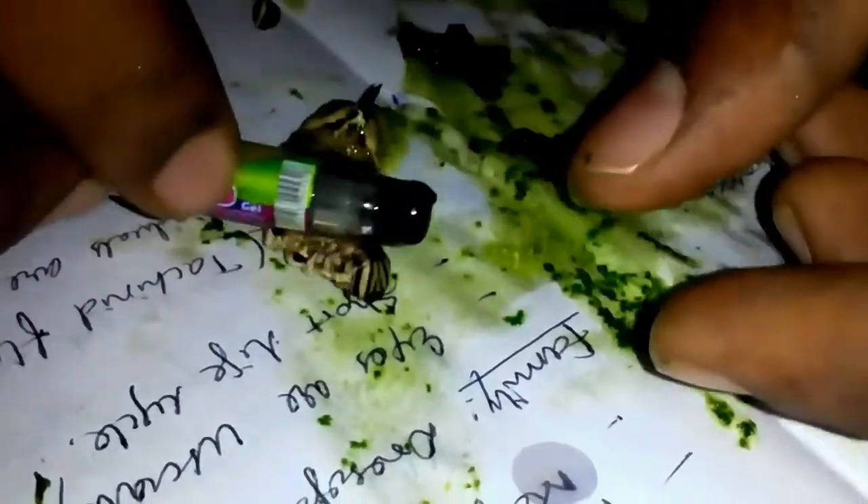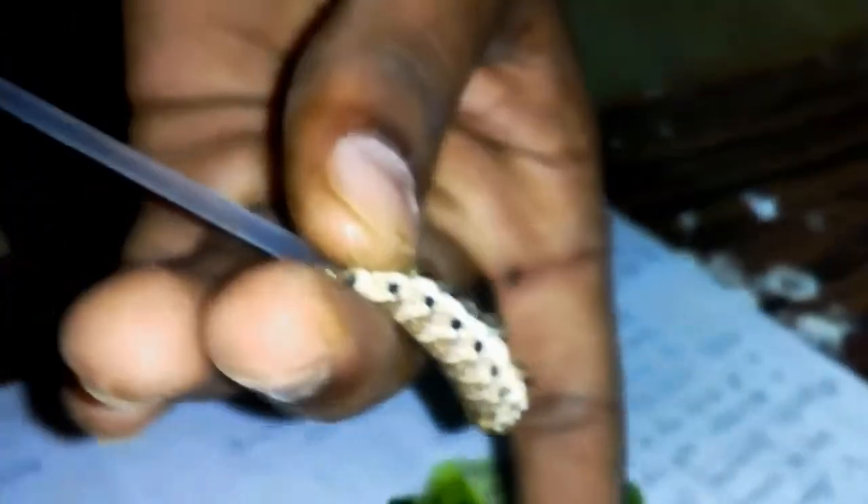Use a small sized disposable syringe for blowing. Here we use the commonly available materials and dry the larvae. At last, tie the anal end. Preserve it for longer days.